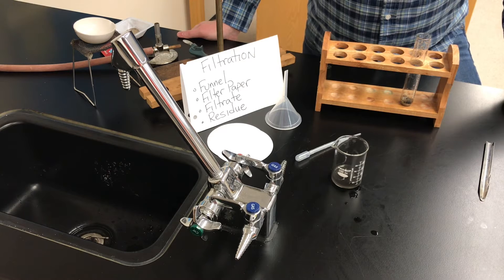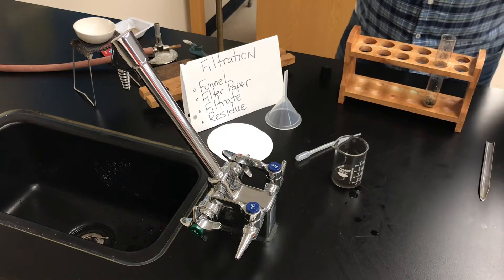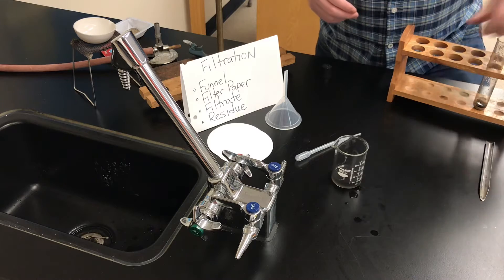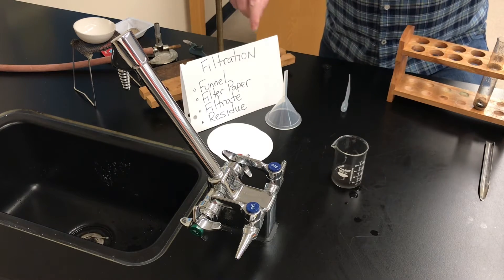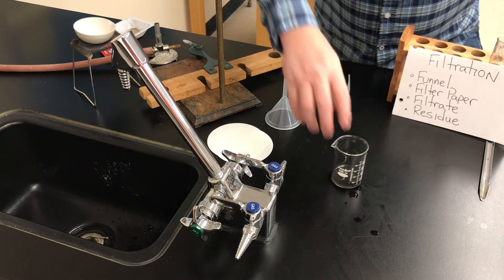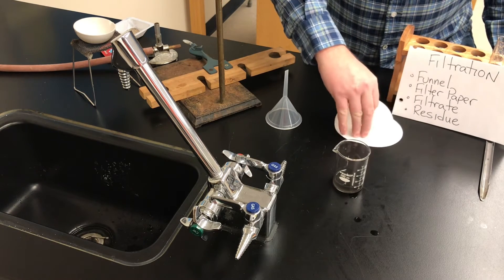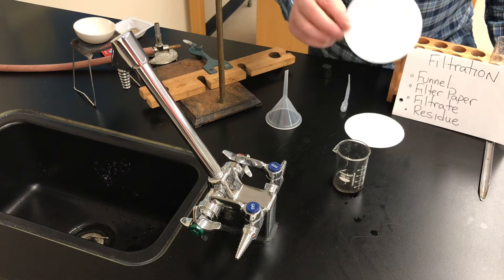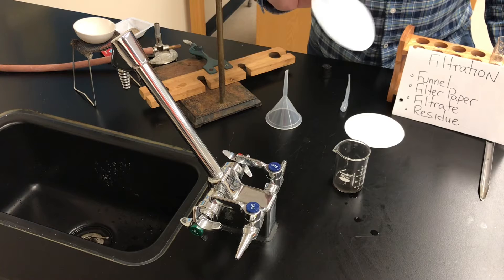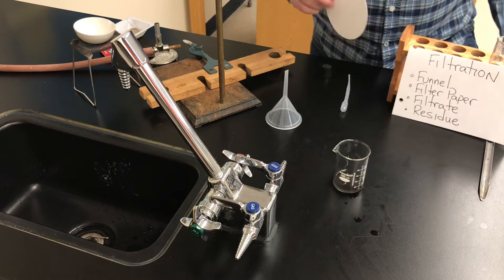Pause the video and see if you can predict what I'm going to do next. I've decided now to do a filtration step. You may have done a filtration back in middle school or elementary school. I've got here a piece of filter paper — also called a filter circle. It's just paper that is porous so water can pass through it; it's kind of like a paper towel but a little bit different.